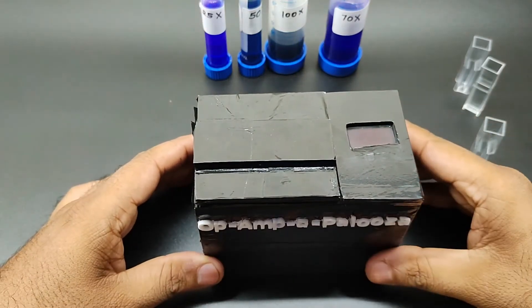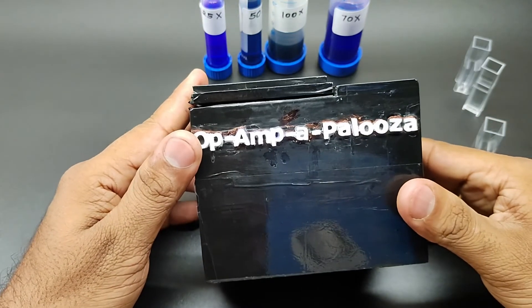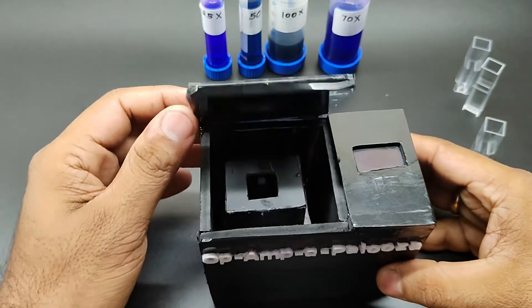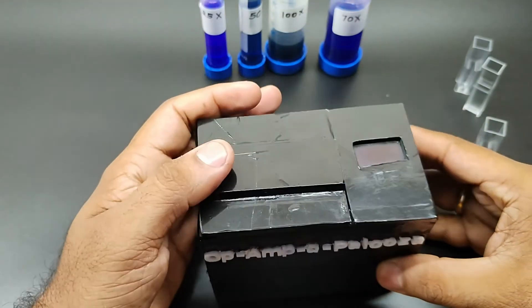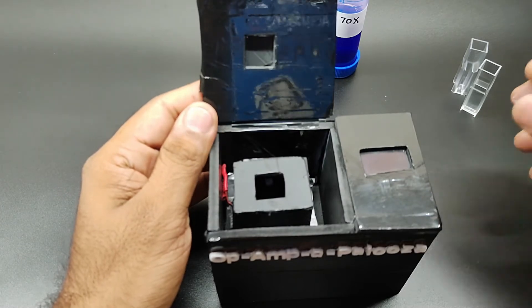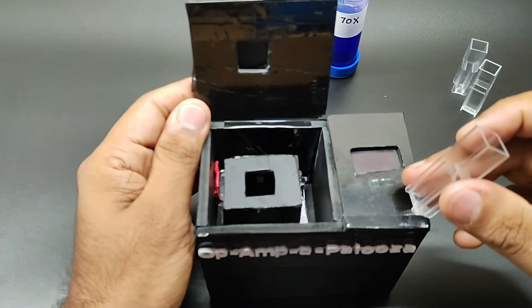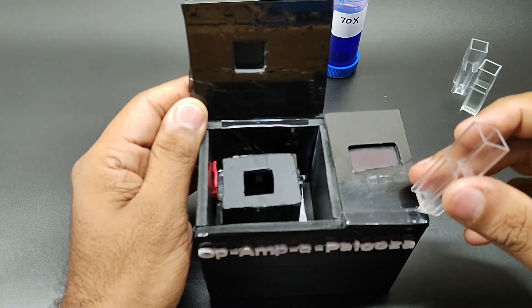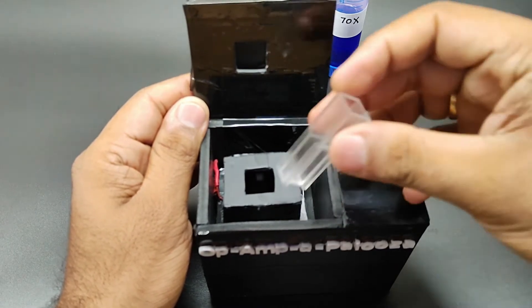This is a spectrophotometer — it's a proof of concept design. Using this spectrophotometer proof of concept, I am going to find the absorbance of the liquid in this experiment. For this experiment we need a cuvette to put the liquid in, and we need only one milliliter of liquid as a sample. Now I am going to insert the cuvette inside the device.